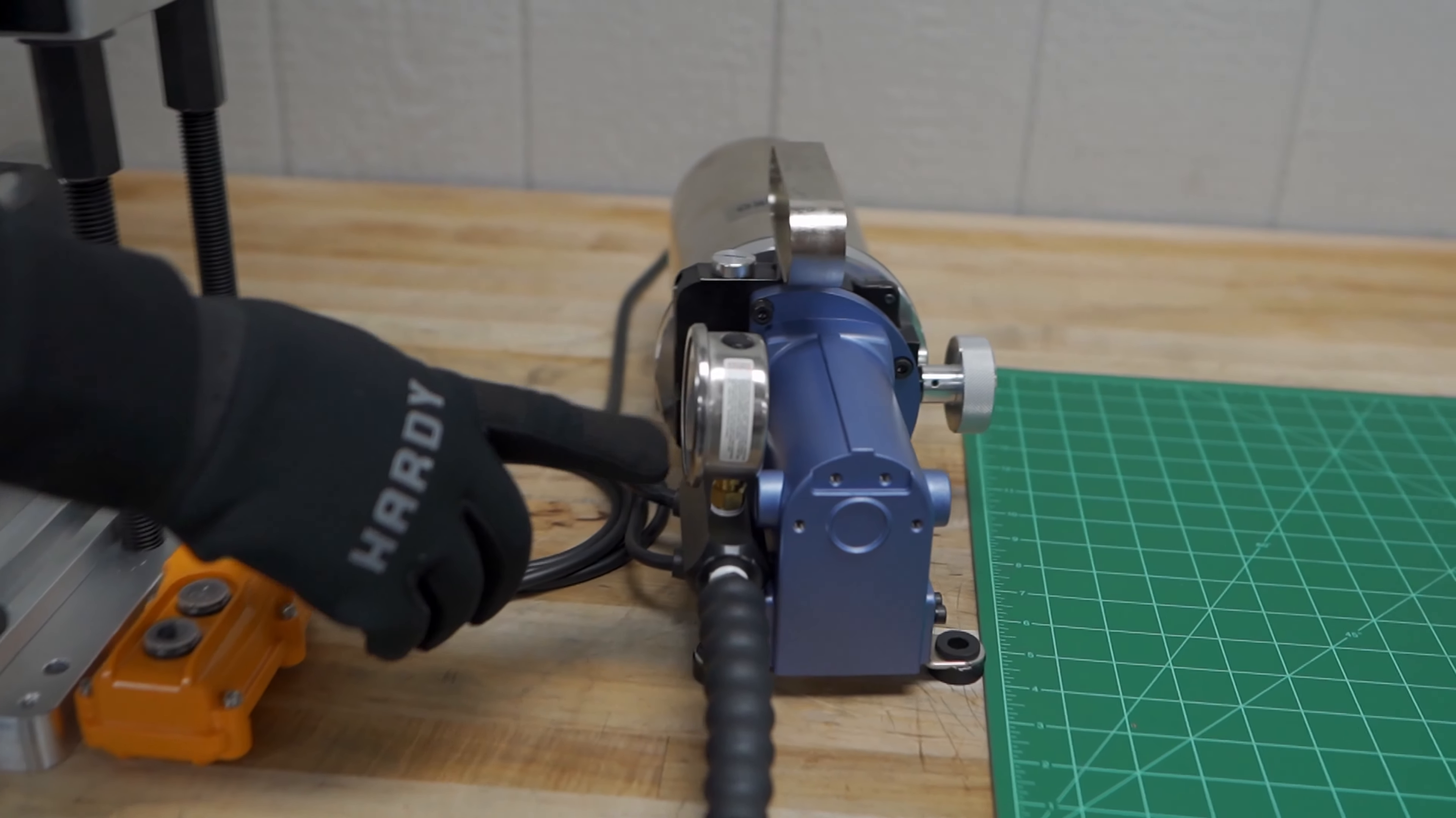Now we're ready to inject by pulling down on the injection handle, and you can just count in your head whatever you think is necessary for the part. In this case, I'm going to do about 10 seconds, and release the handle.